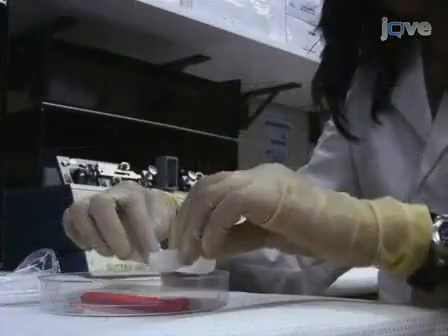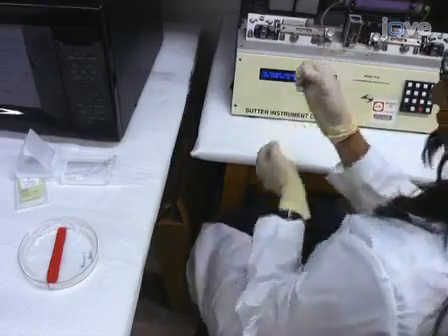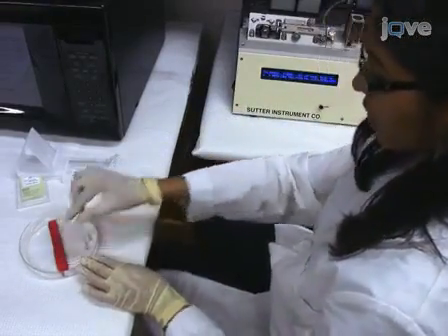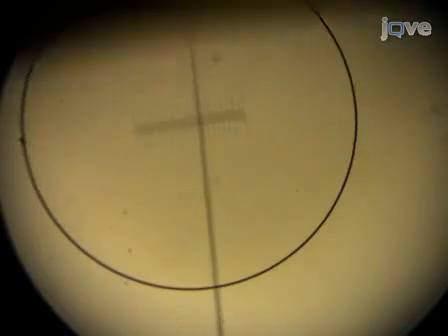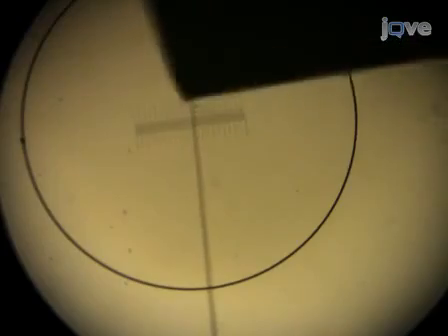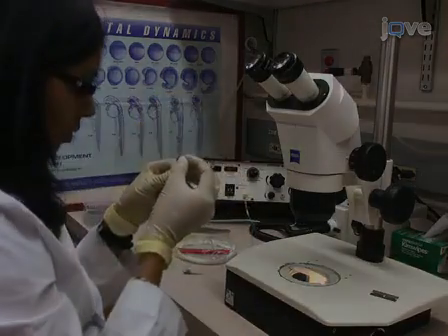Place wet Kim wipes around the edge of a 100 mm petri dish. Carefully secure a glass microinjection needle on a strip of wax inside the humidified dish. Under a dissecting stereo microscope, align the needle against a graduated slide. To obtain a tip of the appropriate size, use a clean razor blade to gently tap the needle where it has a 1 micrometer diameter. Connect the needle to the microinjection apparatus.